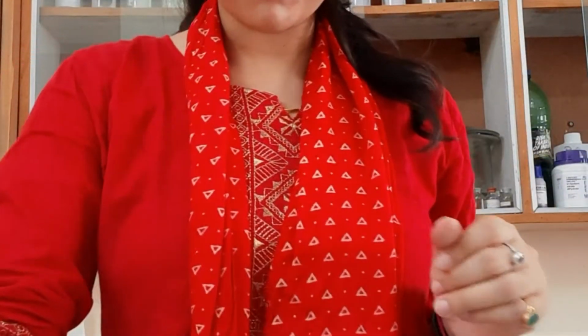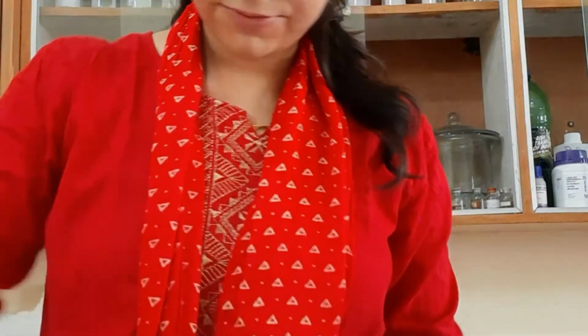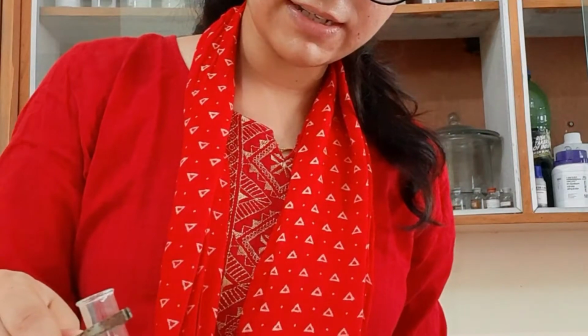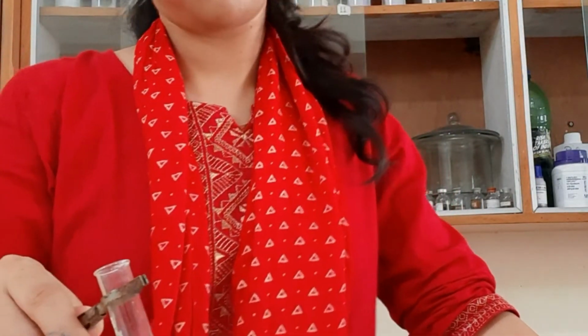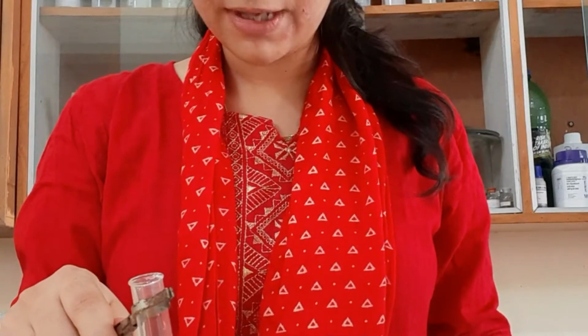The next step after adding the Benedict's solution is you have to boil it. We have to boil it. So as you can see, I am using a candle for boiling, right? And always be careful when you are dealing with fire. Is it clear? Right? So till then it will boil. I will keep it like this. If the glucose is present in the urine, then there should be a precipitate.